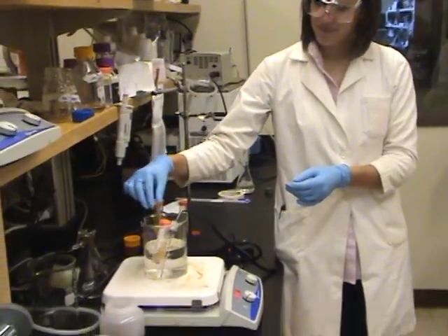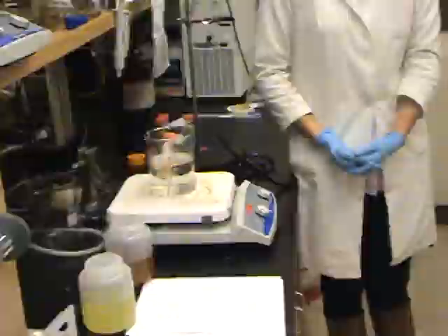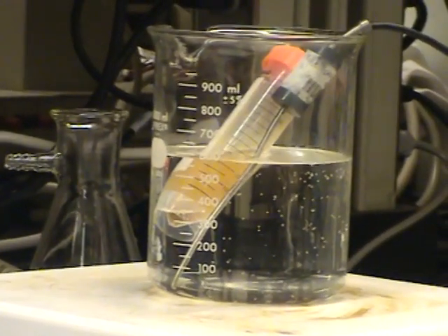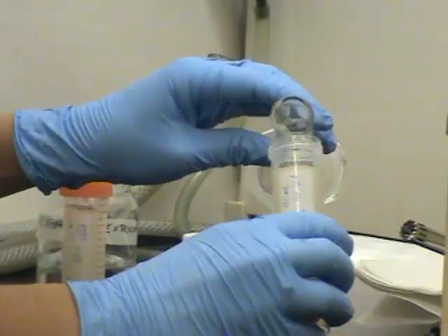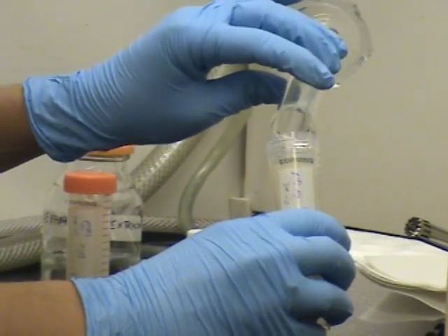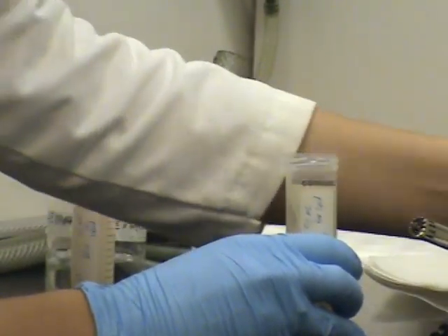Place the homogenized beaker into a hot water bath set at 55 degrees Celsius for five minutes. Repeat the extraction process and homogenize the solution for an additional five minutes.